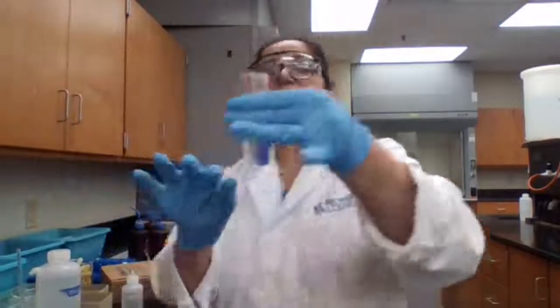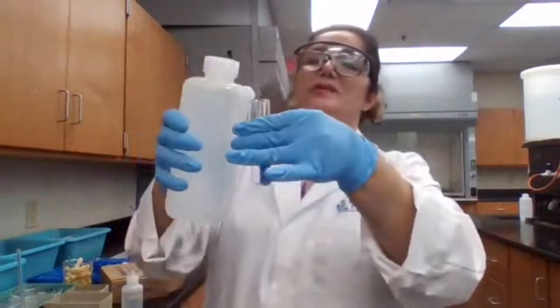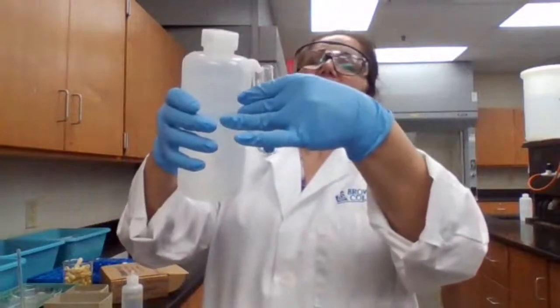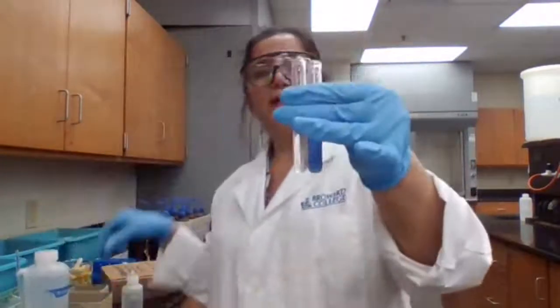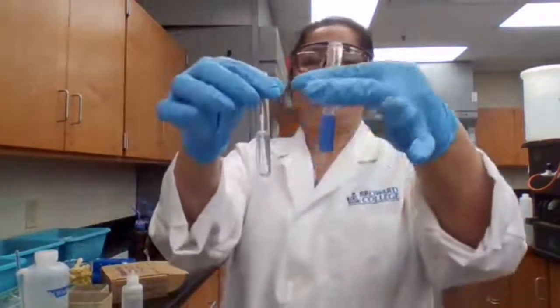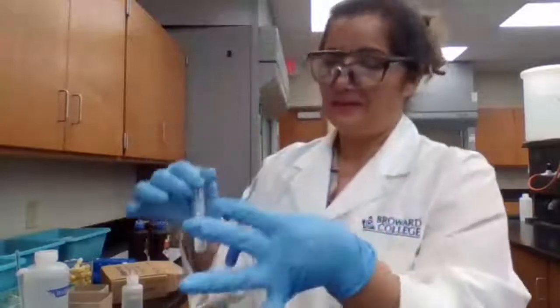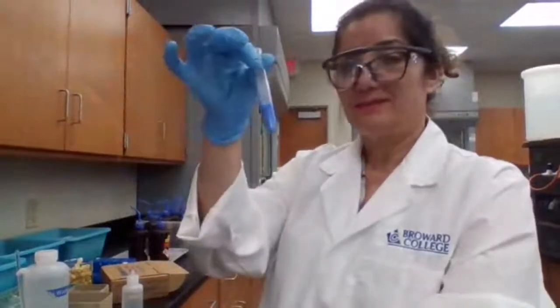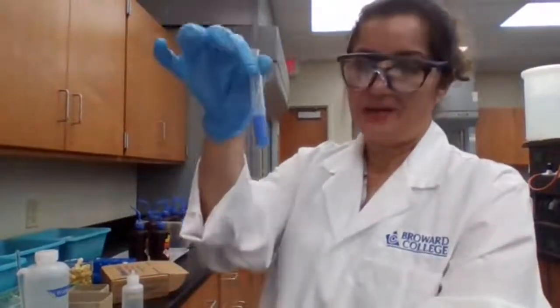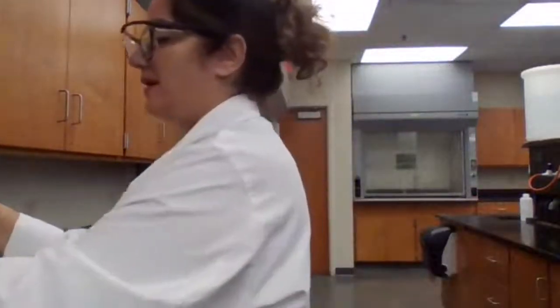The counterpart of the test tube that I'm trying to centrifuge has to have the same mass. Because the density of this solid is now greater than the water, I add a little bit more water, because the mass actually has to be the same. For a perfect technique, I should place it on the balance, on the scale, to see how much it weighs and then make sure that the other test tube weighs the same.